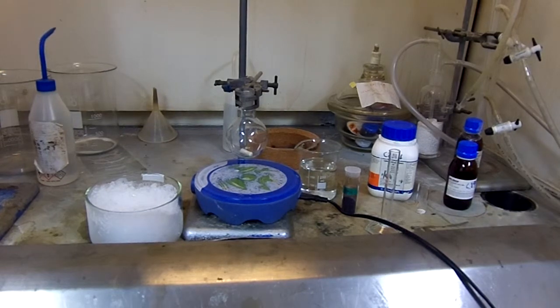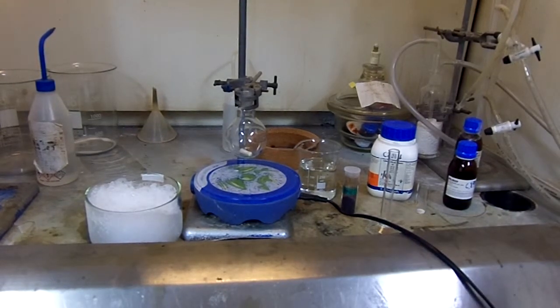Hello and welcome back to Porphyrin Bootcamp. Today we'll be showing you how to carry out the mononitration of tetraphenyl porphyrin using sodium nitrite.